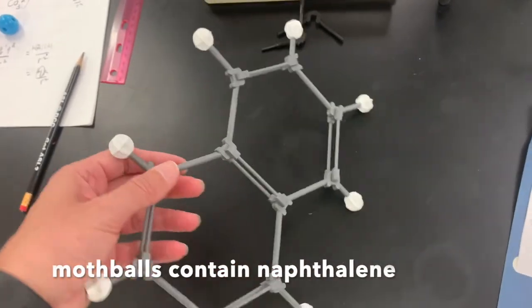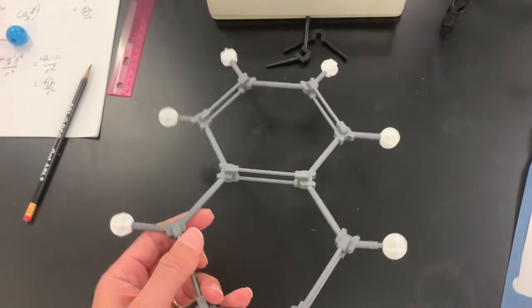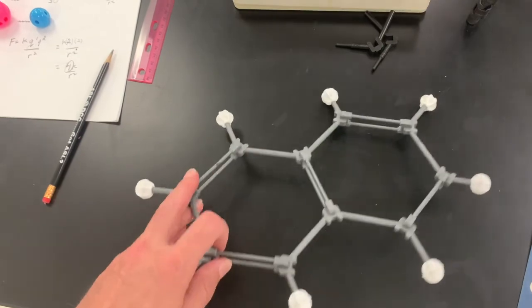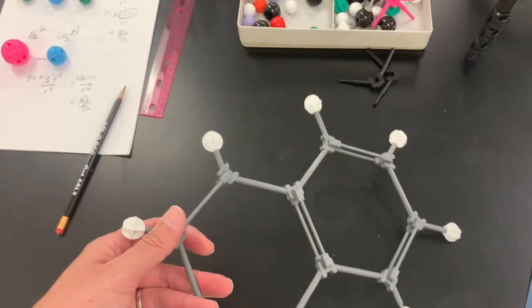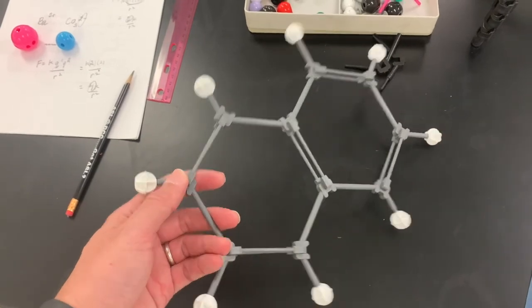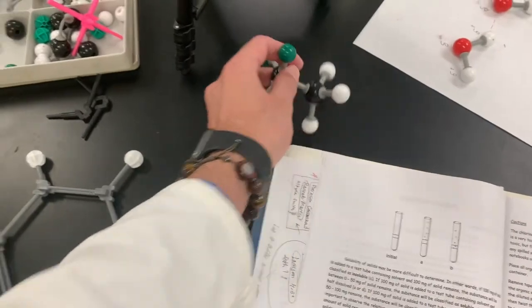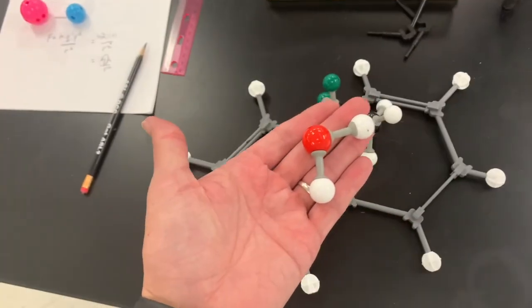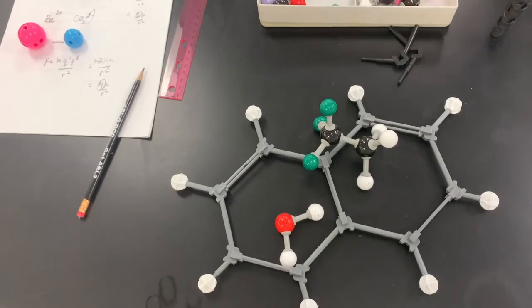Naphthalene forms mothballs, and since these can stack together a little bit, they don't really form strong intermolecular forces, okay? And this substance can volatilize or sublime quite easily, and that's how mothballs just disappear, okay? So that's naphthalene, okay? So you want to think about what solvent that's going to be compatible with. Is it going to be compatible with trichloroethane, or is it going to be compatible with water, okay? So let's go ahead and do the chemical solubility test and see what it looks like.